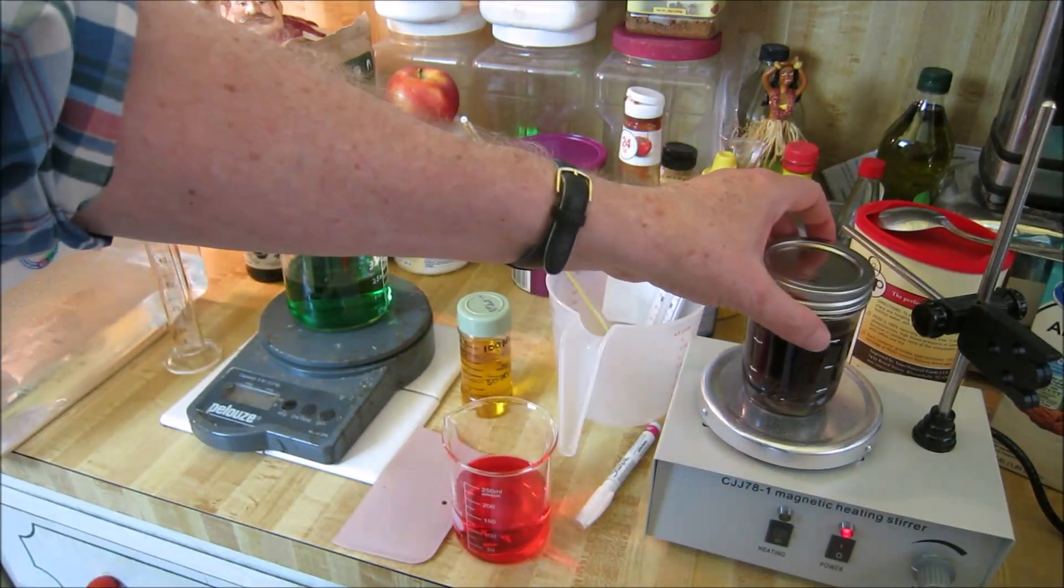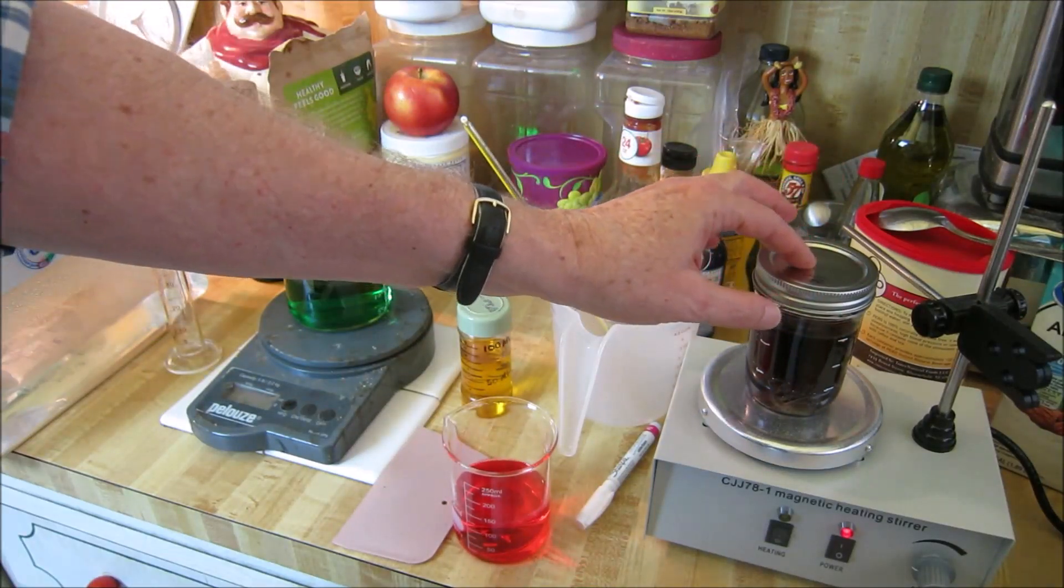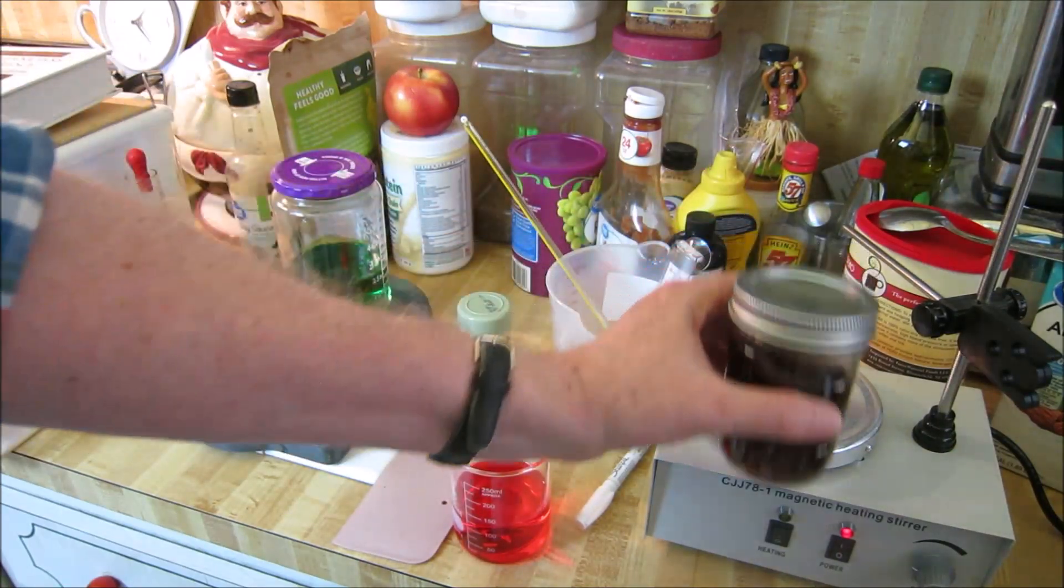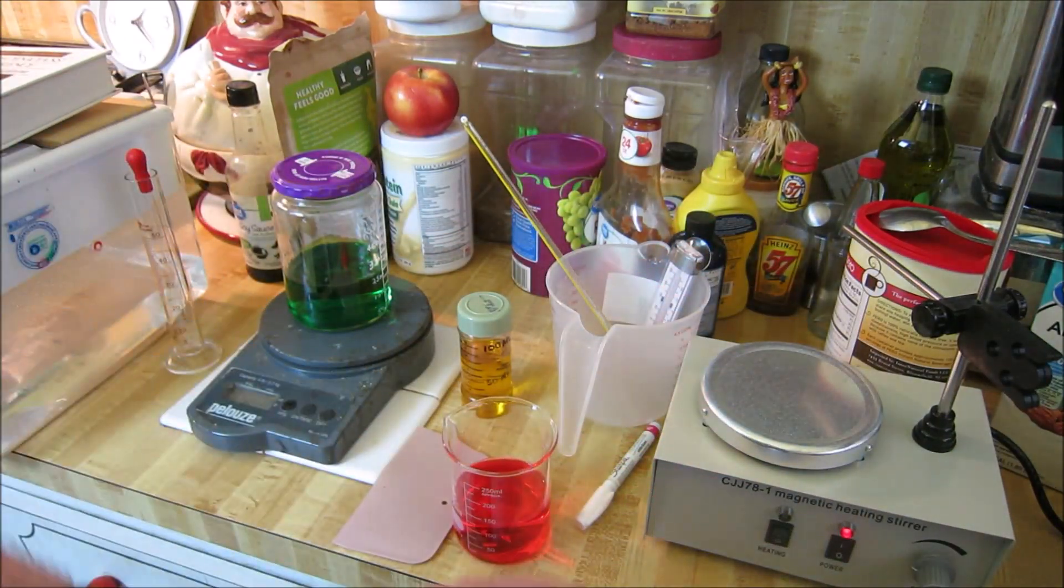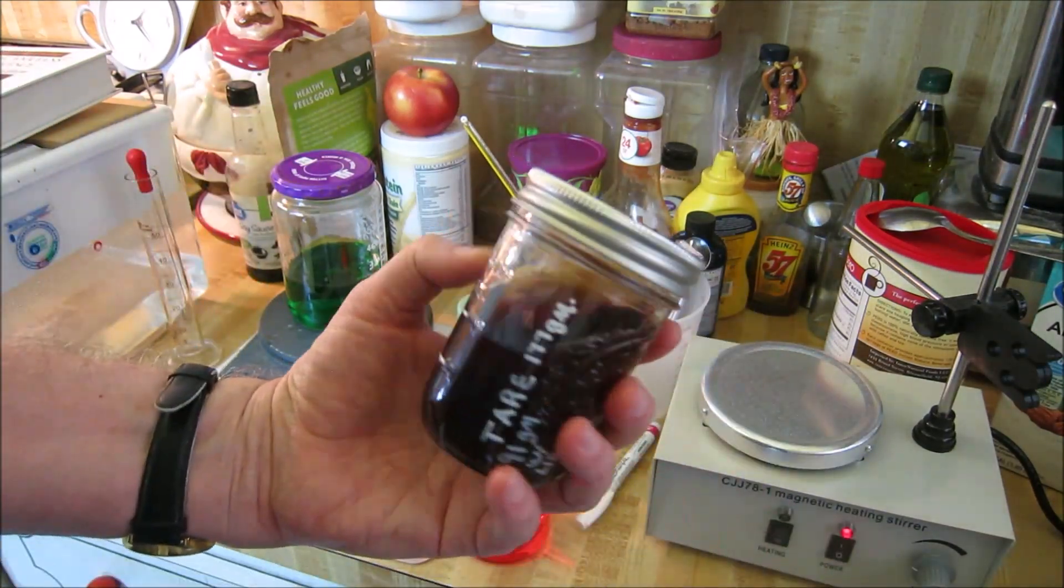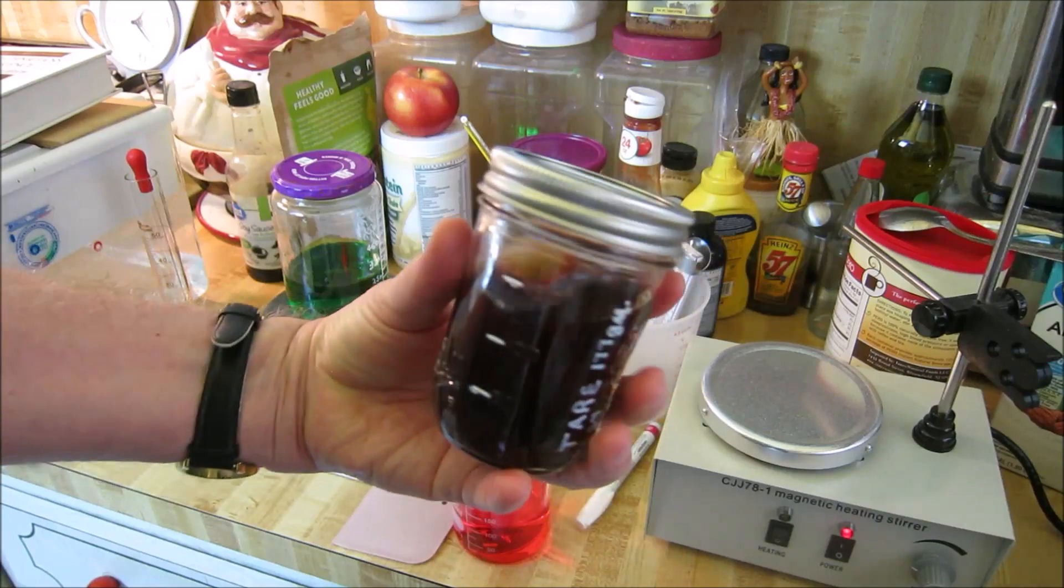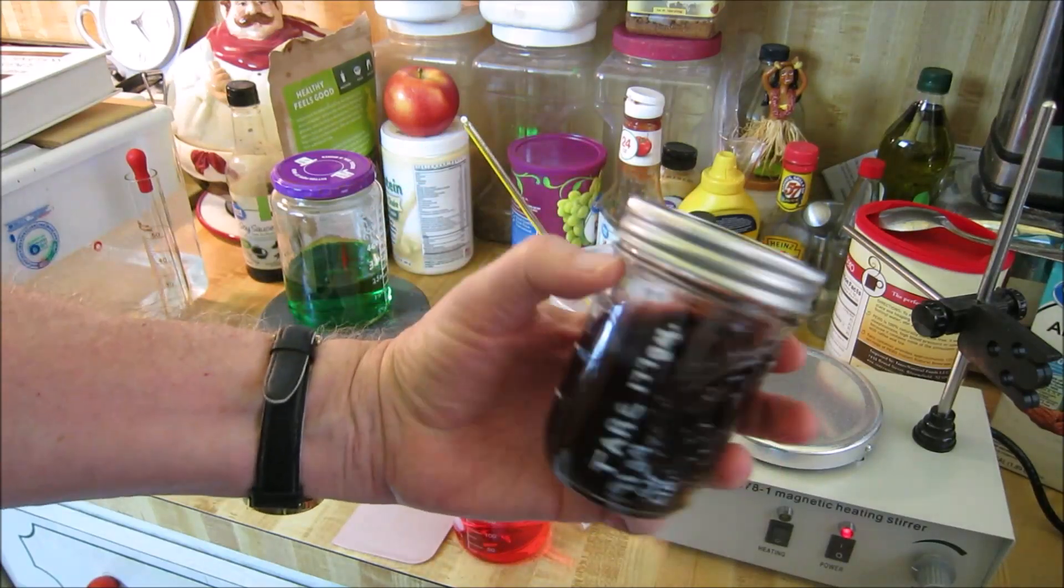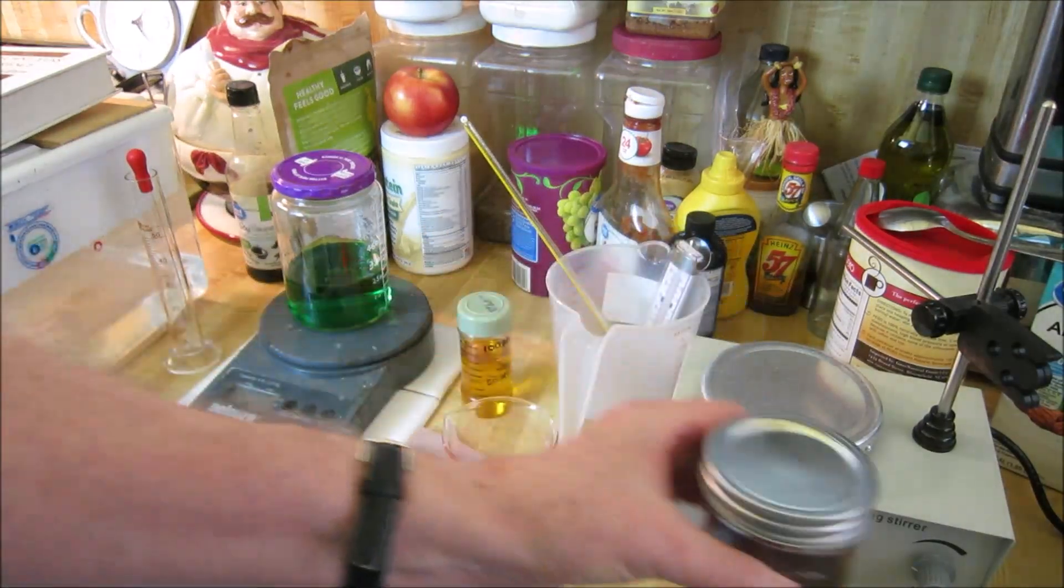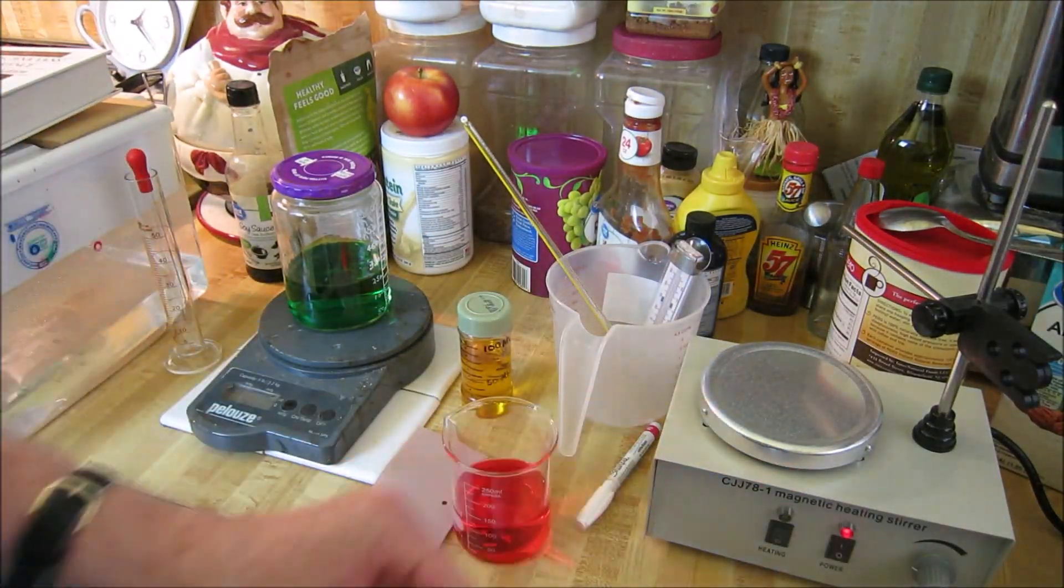Okay guys, I hope this little video is something that is helpful to you. Not a lot of people know that they can make their own glassware using a scale and 20 degrees Celsius water. And I don't know how many people have validated the measurements on the ball jars. So it's pretty handy, these ball jars. I think you could probably do a lot of lab work with the ball jars. So that's the video for today.